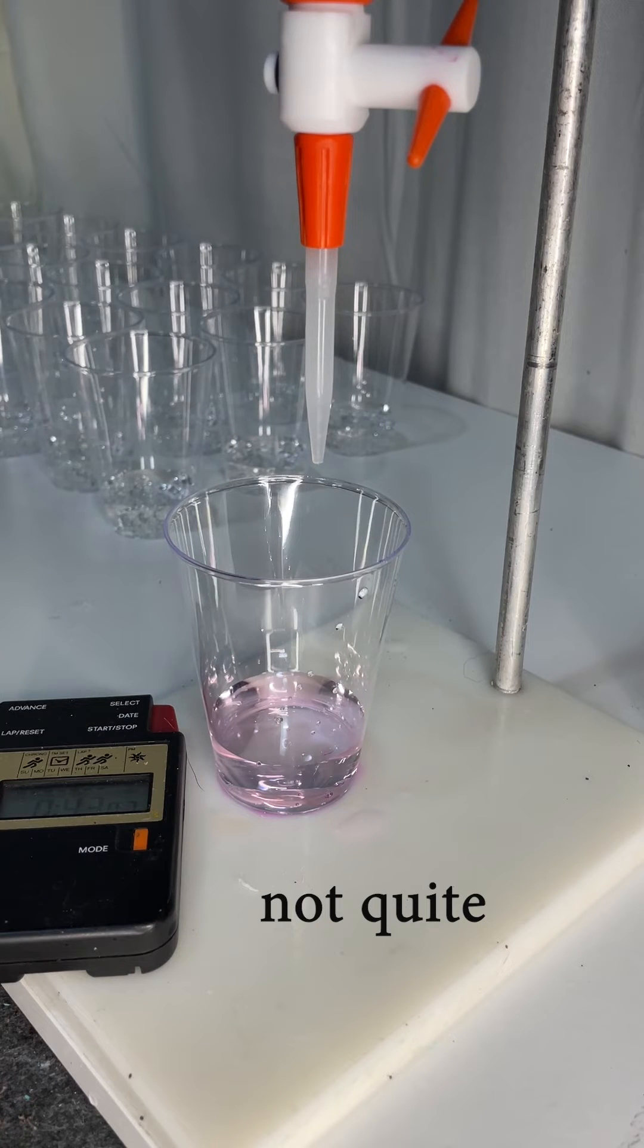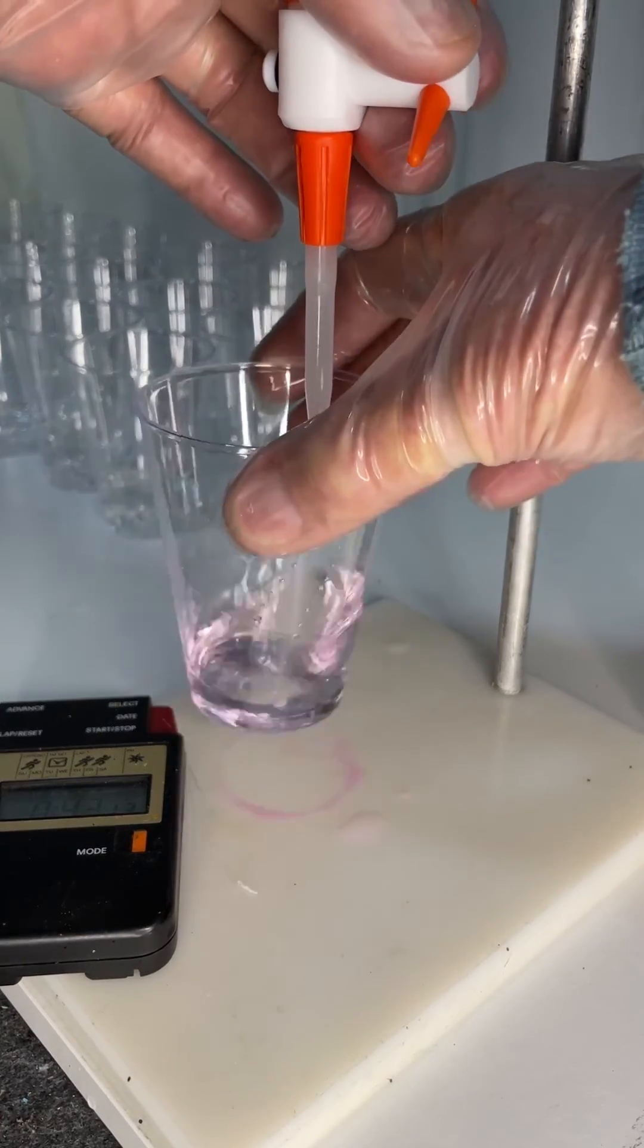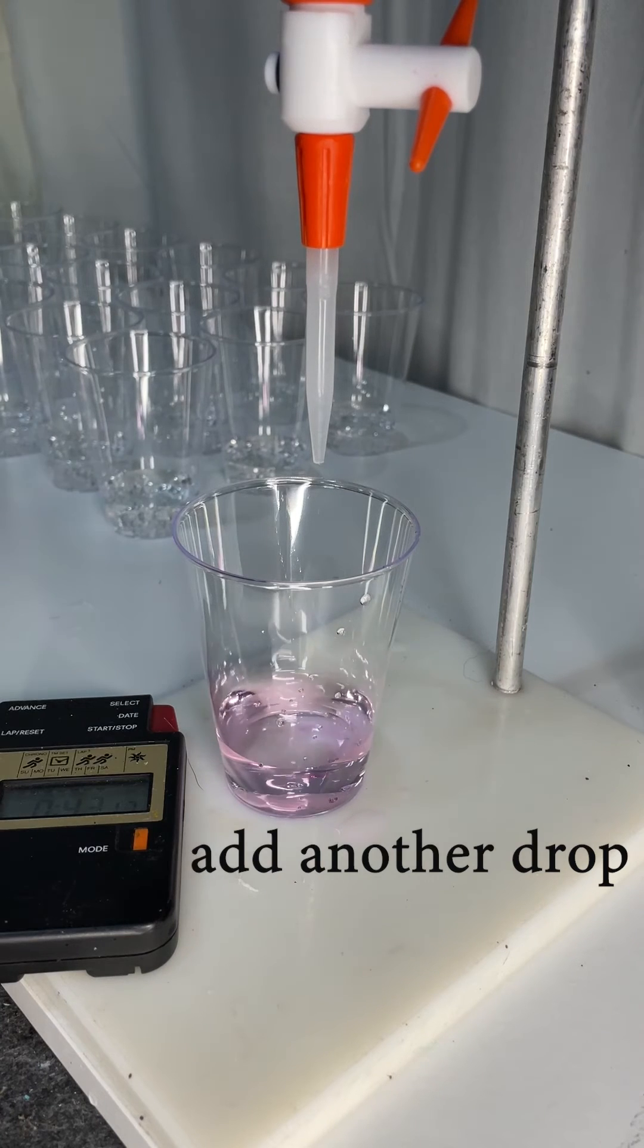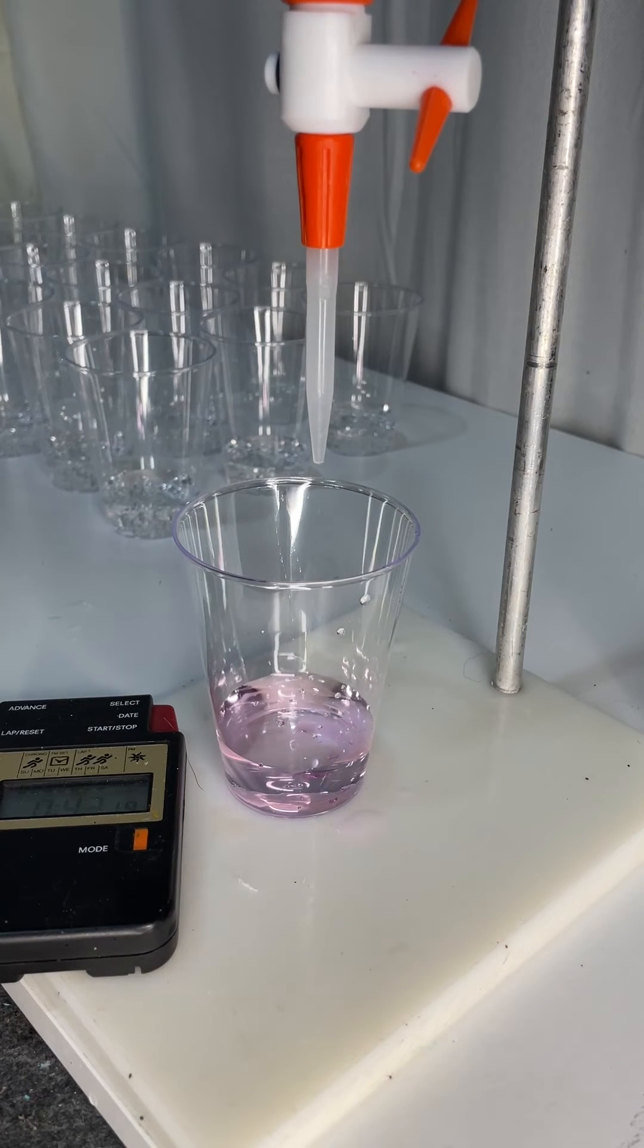So almost there, I've almost got all of the carbon dioxide titrated. So let's try another drop and I think this might be it. It's staying pink and we just have to watch the stopwatch to make sure it stays pink for 30 seconds.